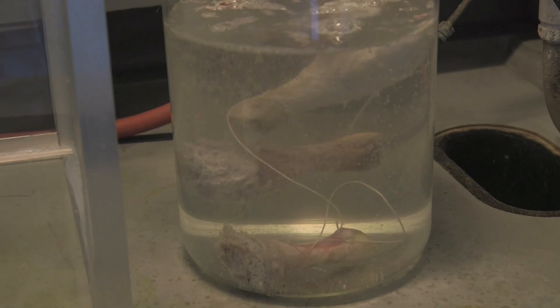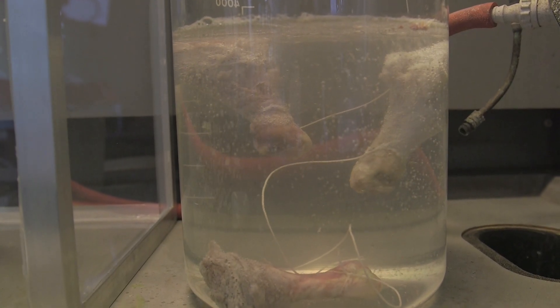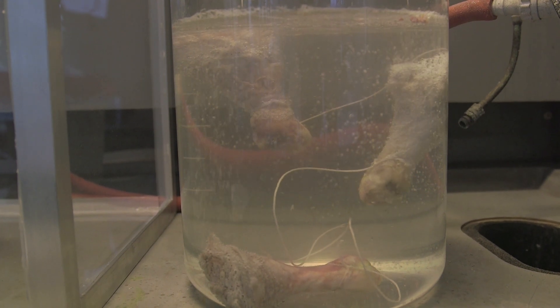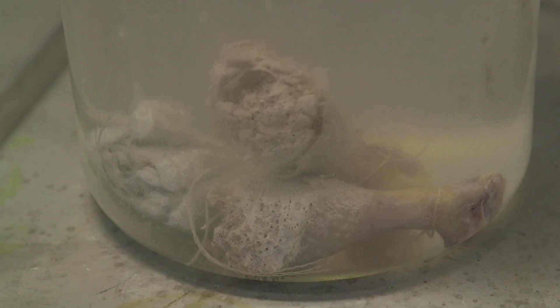The HCl and the HF both stayed near the top. The HF really bubbled much more, suggesting that the acid could penetrate much better into the meat. A chicken's leg is not just meat — it is highly structured muscle so that the chicken can run around. But all of that structure has been destroyed in the case of HF. With sulfuric acid and HCl there has been some destruction, but the meat is still recognisable as meat. With HF it has gone completely white, and there is more bubbling because this white mass is now like a sponge and can absorb much more acid.